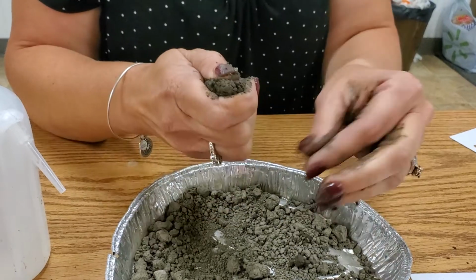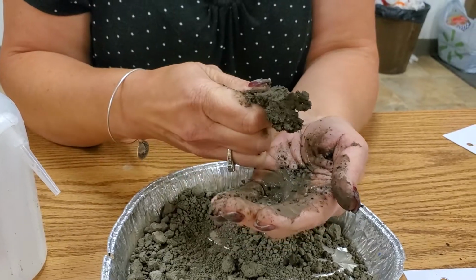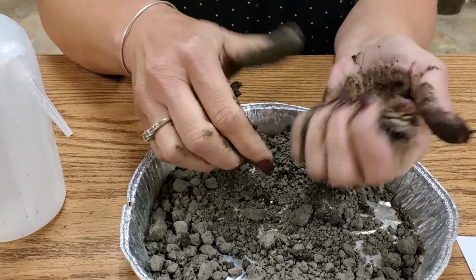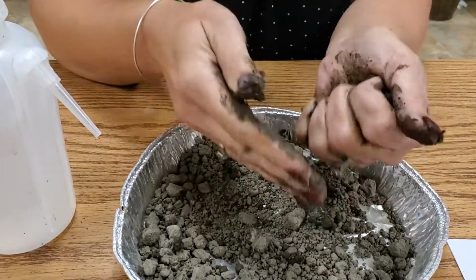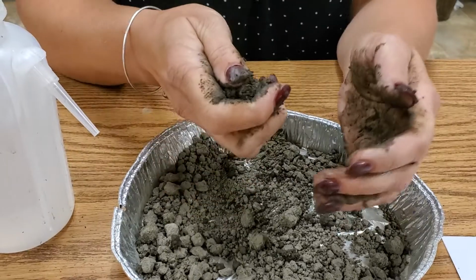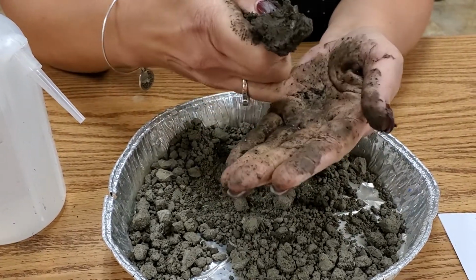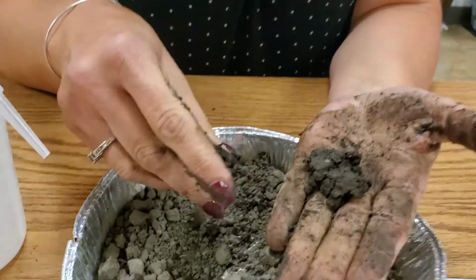We're then going to put it between my thumb and forefinger, and we're going to start to form a ribbon. That formed a pretty long ribbon, but I also moved my hand in the interim, and I think I need it to be a little bit larger because I didn't have enough to push it. See, you guys were supposed to be doing this, not me. Don't worry, you guys will get to do this eventually. So you're going to keep pushing it with your finger, and it's sticking to my hand too much to do a good job. And work your way down. And you can see that if I was to stretch that clod out, it's at least 1.5 inches, if not longer.